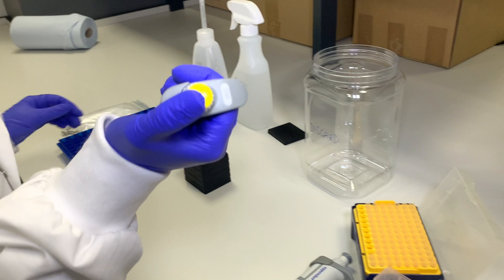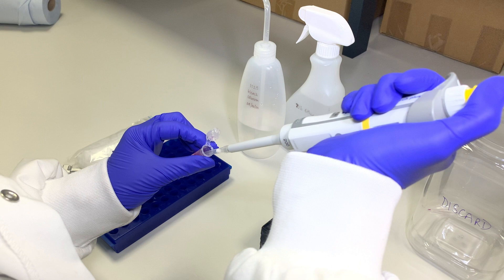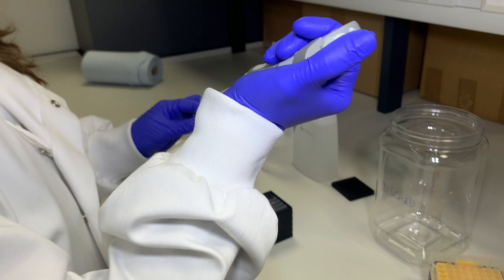Start by aliquoting the qPCR master mix into each tube. Now add your samples to each tube.